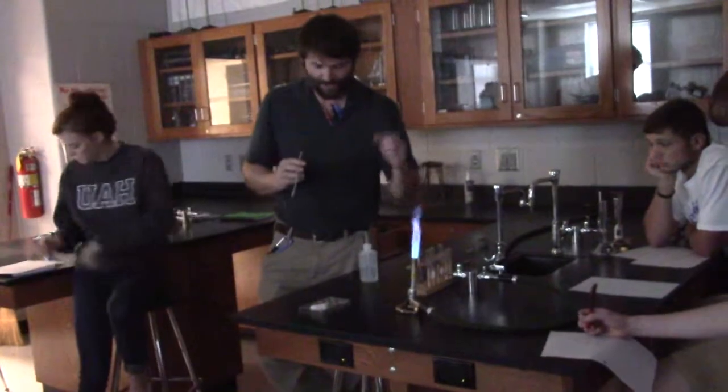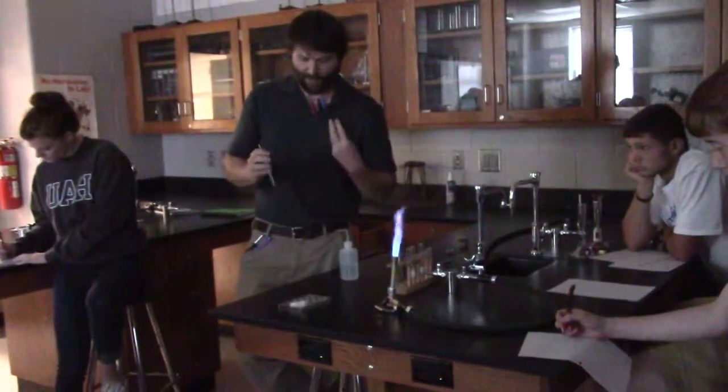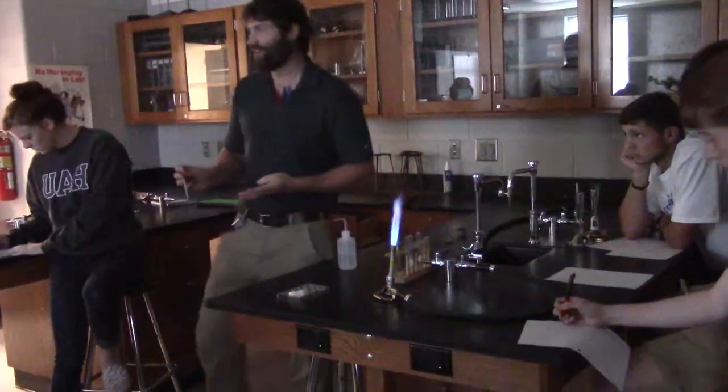So I don't know where we're at on steps. Step number 1, get that. Step number 2, get acid. Step number 3, clean loop. Step number 4, burn chemical. Step number 5, clean and repeat for the rest of the lab.